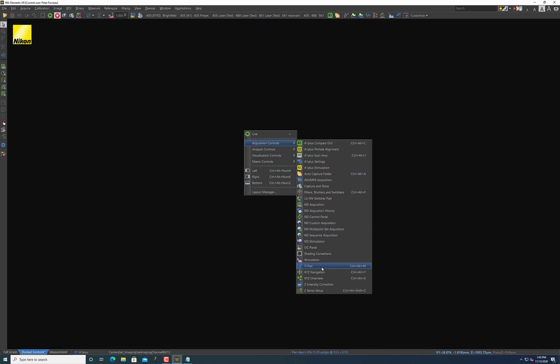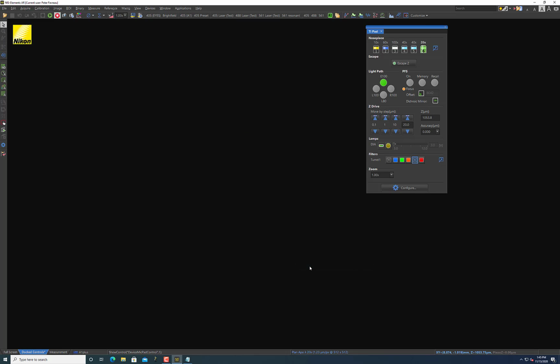So to begin with, let's go ahead and right-click. We're going to go to Acquisition Controls. And all of the controls, at least software related to the LED light source, are housed in this Ti pad option. So I'm going to open that up. Under filters, you can select any number of different colored filters that are already present in there. There's a blue one that's really for DAPI, but it's basically for any ultraviolet excitation emission wavelengths that match up somewhat with DAPI. Same with GFP, and we have a TRITC, and finally we have Cy5 or just a red filter cube. What I'm going to do to start off with is I'm just going to look at green fluorescence in the sample that I have mounted on the stage.